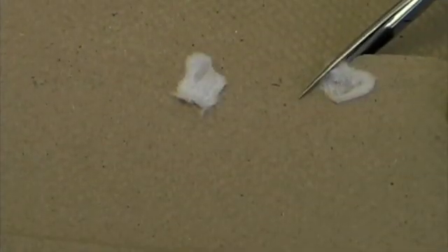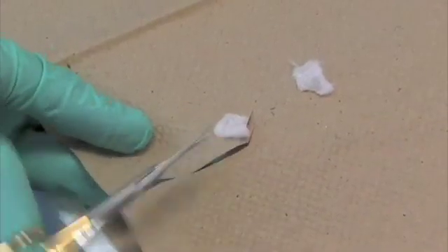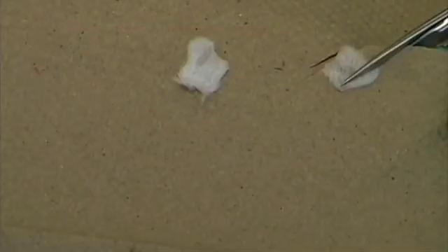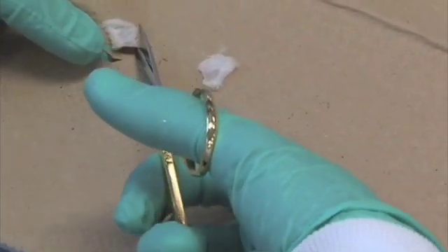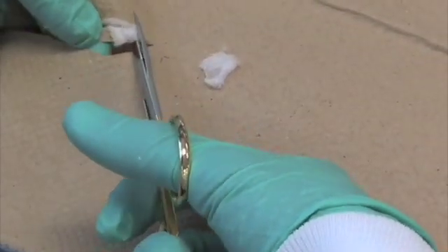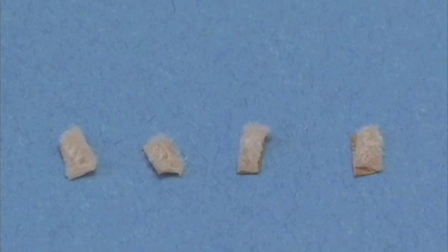Now that we have the skin nice and flat on the paper towel, we cut off the edges, or we trim them, in order to remove the parts that we may have damaged with the forceps. And then you cut the skin into very small pieces, about 2mm by 2mm. Now the tissue is going to be fixed.